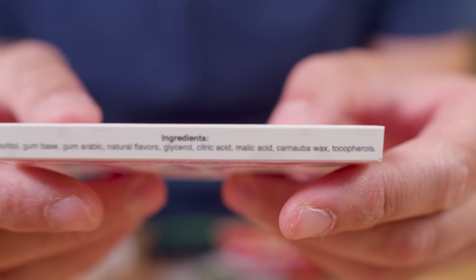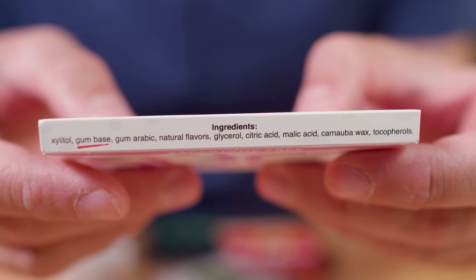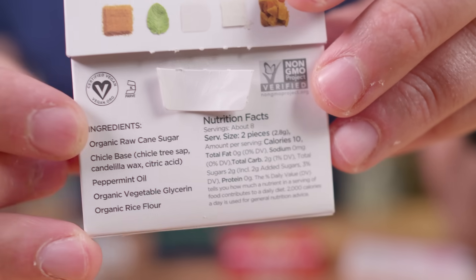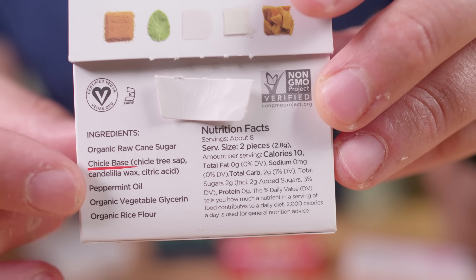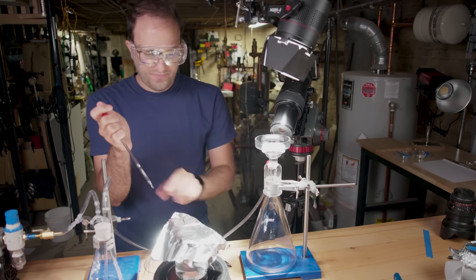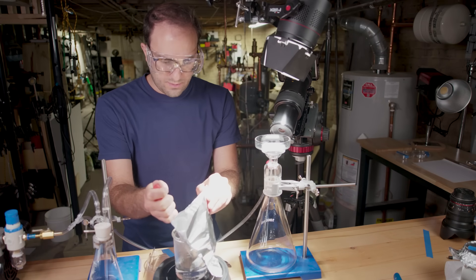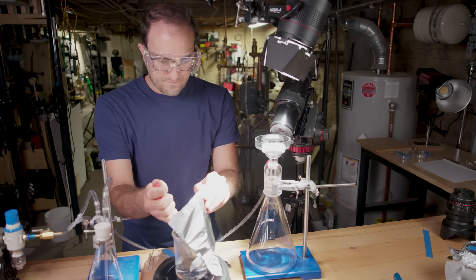Another approach. Chemically, chewing gum is pretty simple: sweetener, gum base, flavorings, maybe a preservative. My instinct is that the only thing not soluble in water on that list is the gum base. If gum base were soluble in water, it would dissolve as you were chewing it — you'd have Starburst instead of chewing gum. So I want to figure out: are these things on my filter paper soluble in water or not? Let's try with warm water, because that would really be the nail in the coffin.